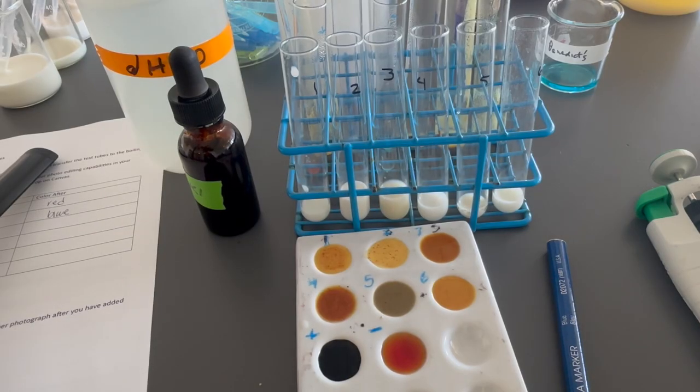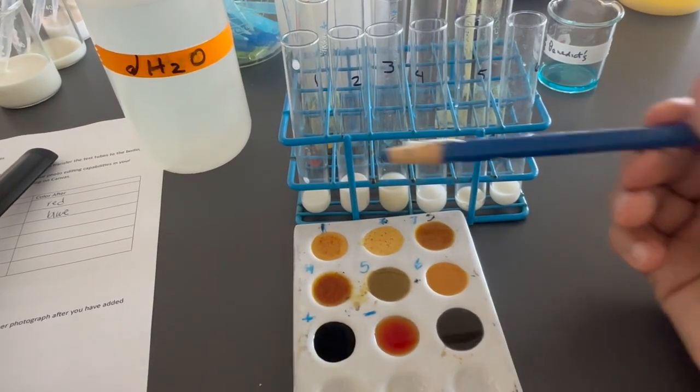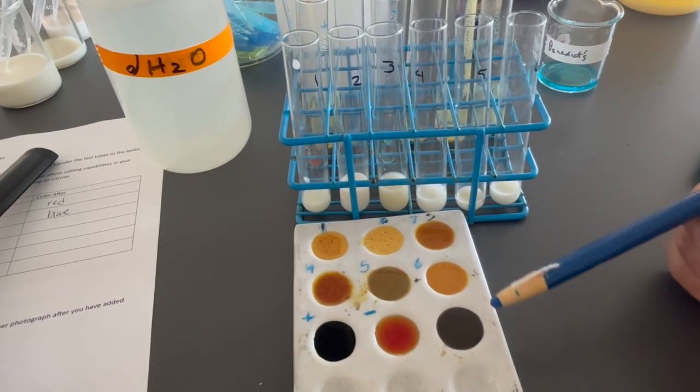So as you can see from these results, product number 5 is the only one that had a reaction for the starch test. Okay, we might have some varying results depending on what type of oat milk is used for sample number 3. Sample number 3 here showed a negative test for starch, whereas when I used a different brand of oat milk, it showed a positive test for starch.